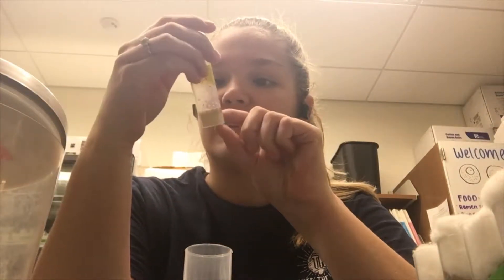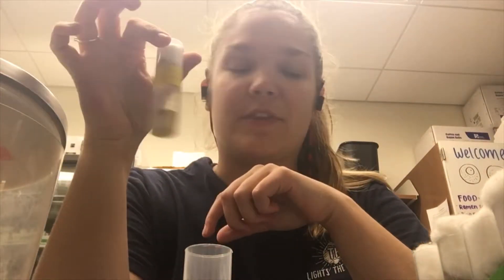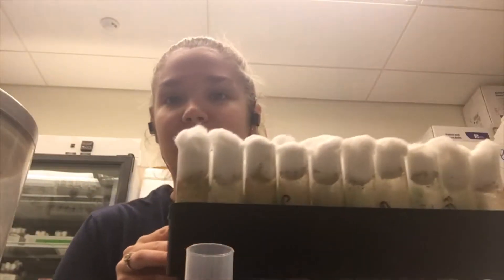I'm gonna make these guys go to sleep before I put them in the vial because I'm not really good at fly flipping. In theory you can just take the cotton off and do that, but I'm not very good at that.